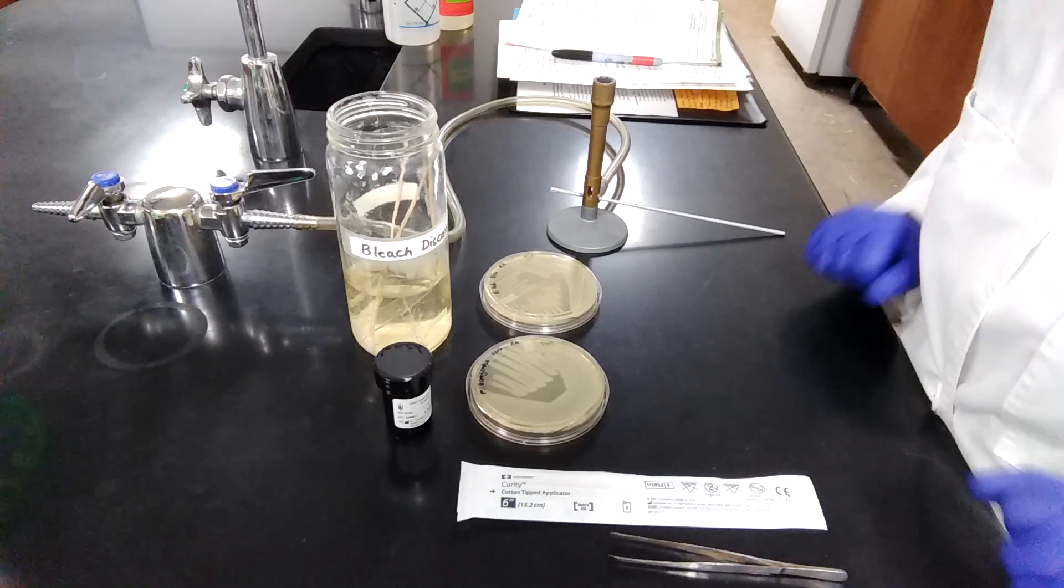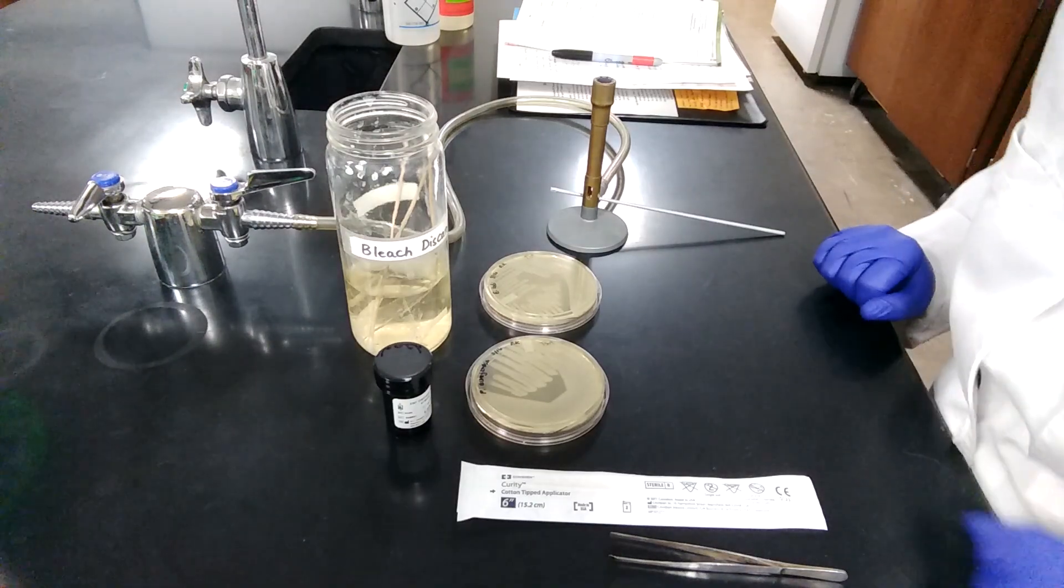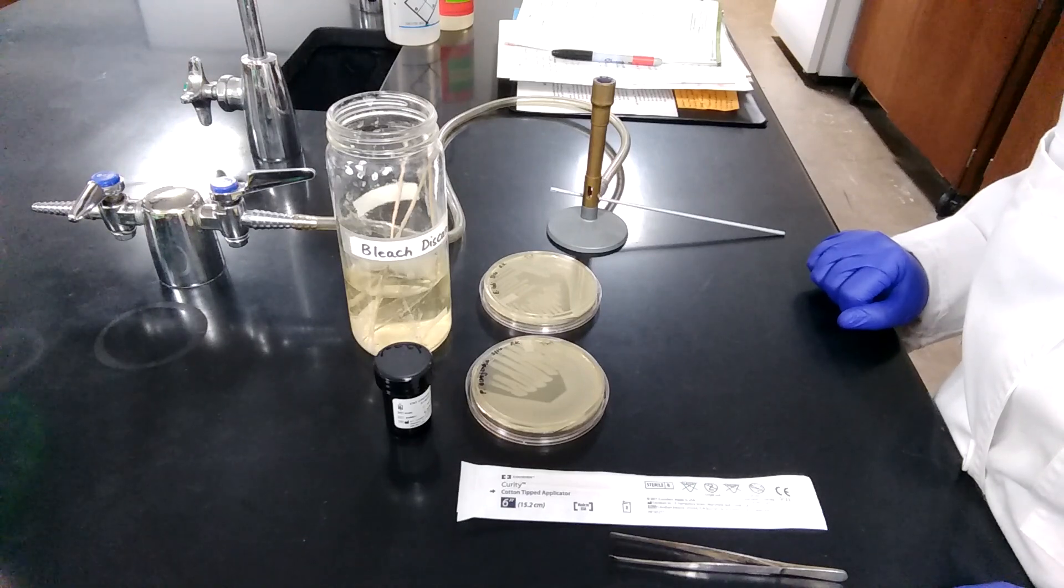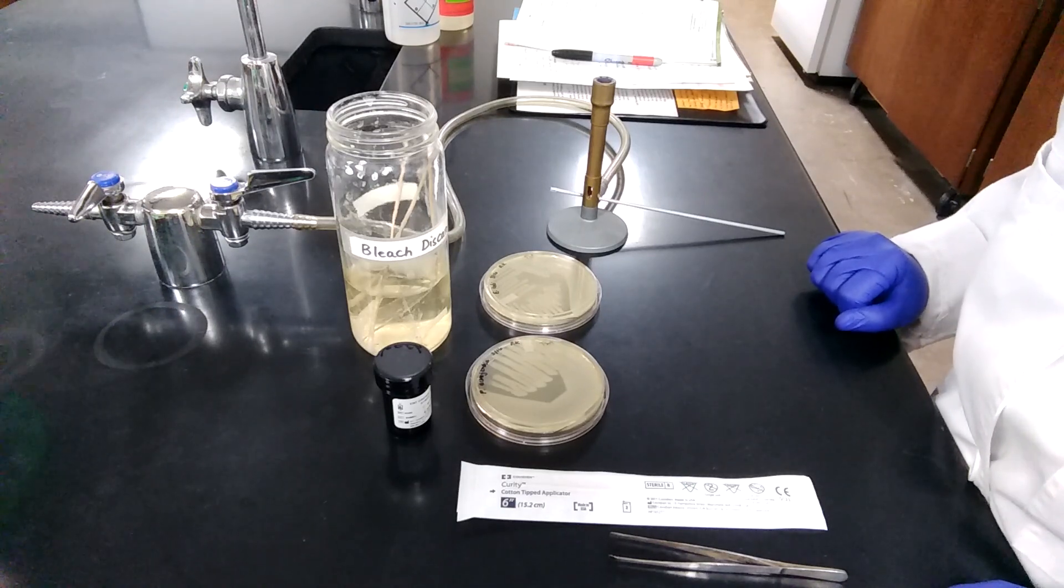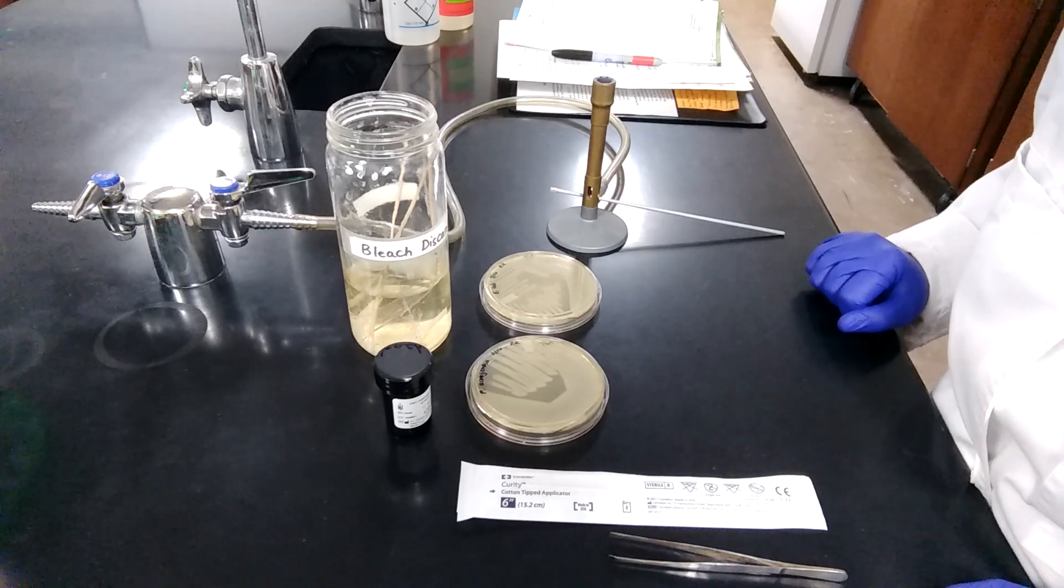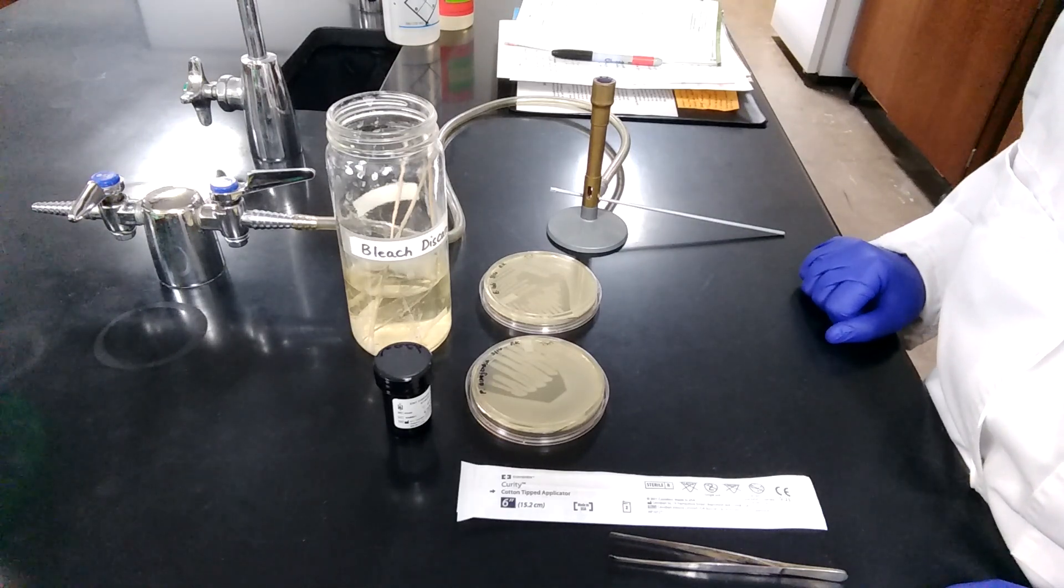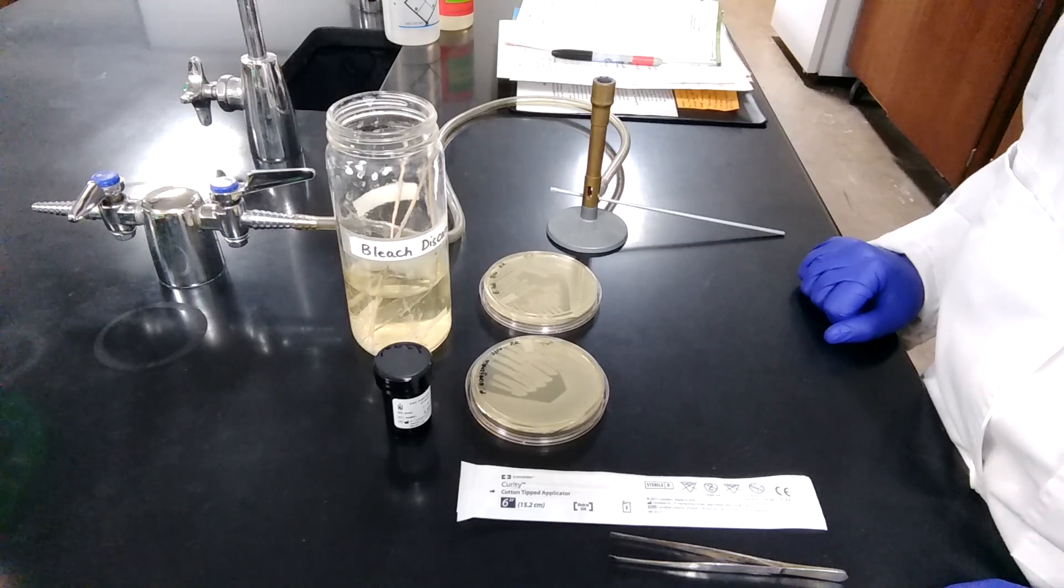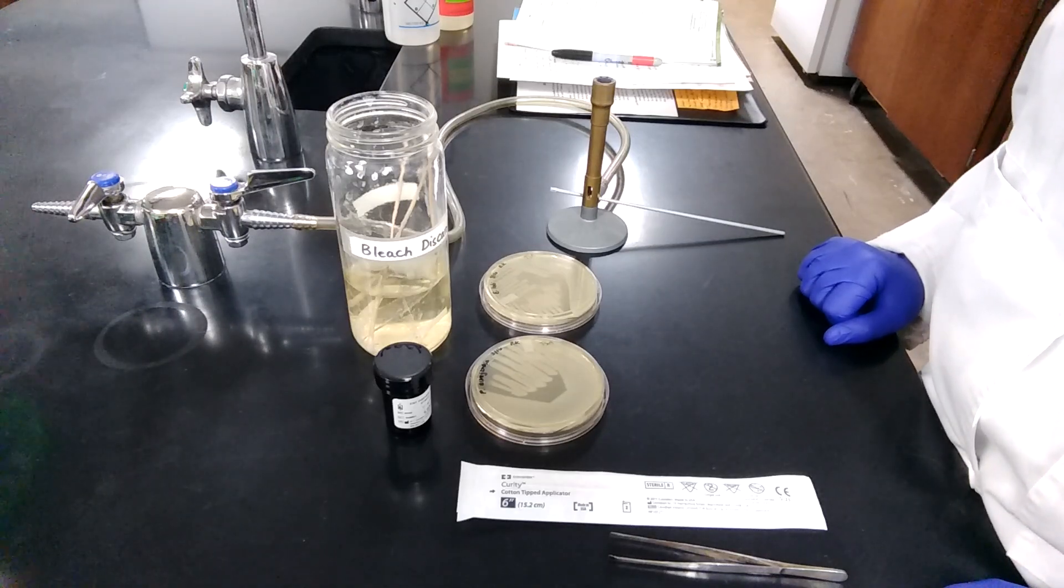I am going to show you the procedure for the oxidase test. The oxidase test is used to identify bacteria that produce the enzyme cytochrome C oxidase. Mostly aerobic bacteria that carry out respiration using the electron transport chain produce the cytochrome C oxidase.